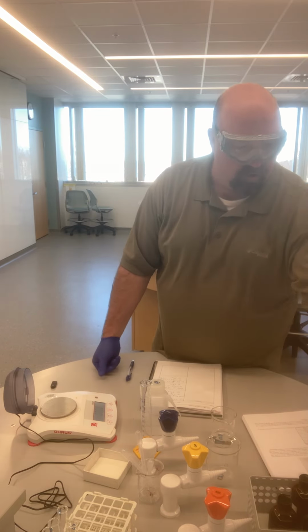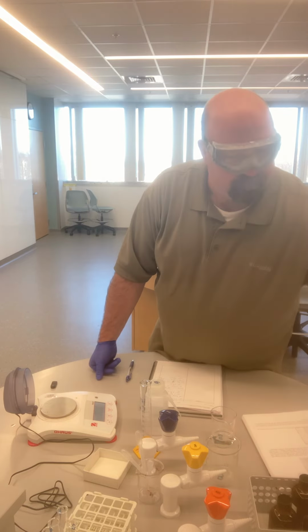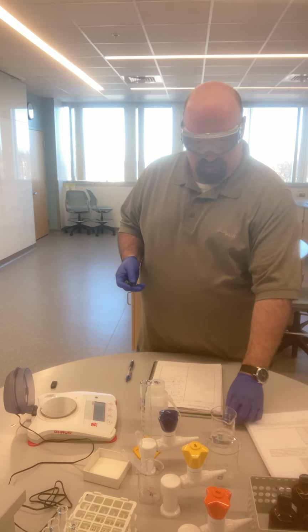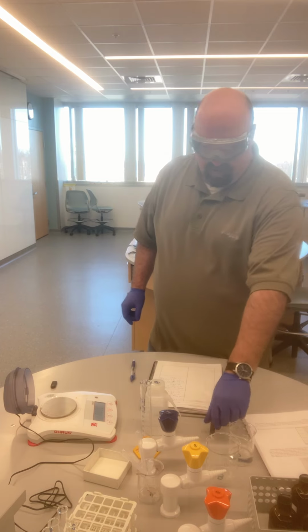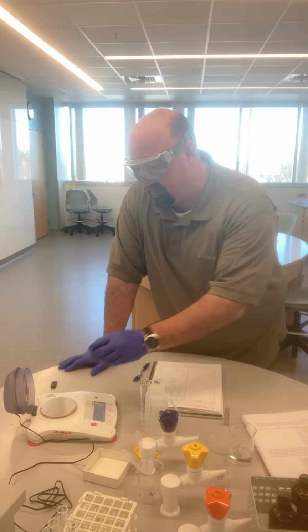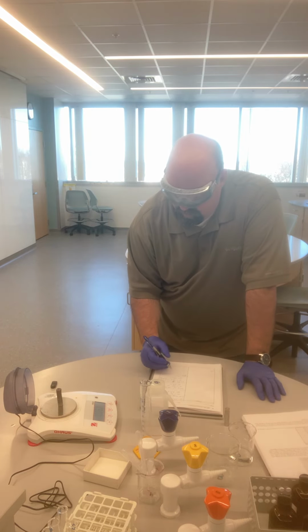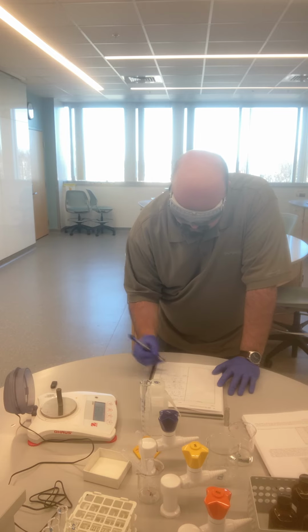And so we're going to find them. I'm just going to pick a couple here at random. We're going to find the mass and the volume information for these two pieces of solid metal. Now the mass is easy enough. I want to note which one I'm doing. I've got metal 16 here. The mass is easy enough. I can just stick this right onto the balance. It was already zeroed. So my mass equals 70.059 grams.